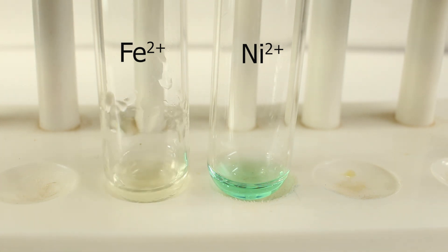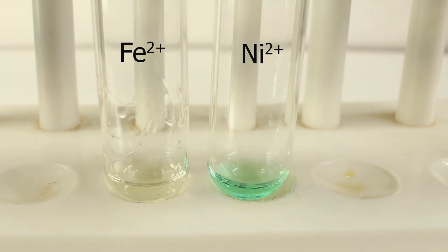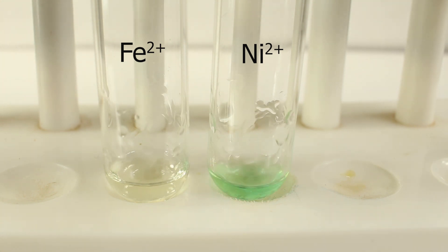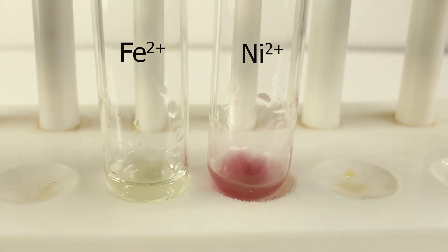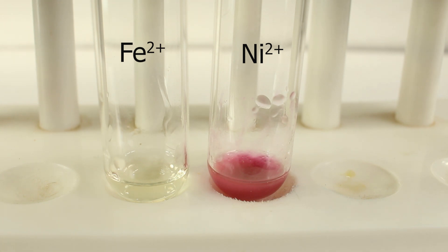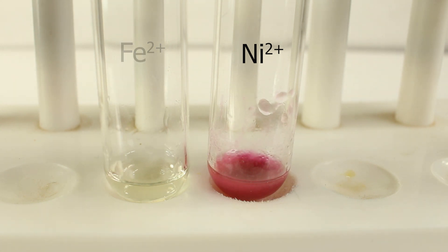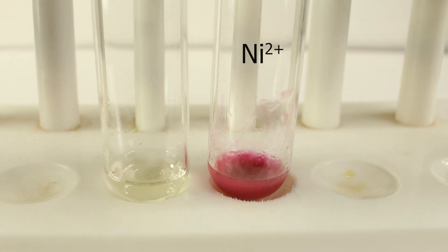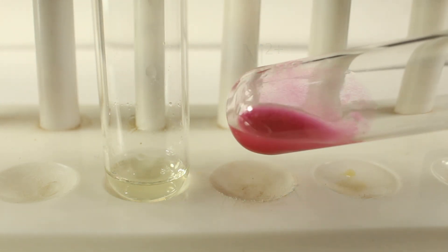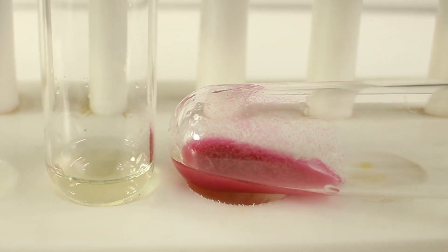No visible change in the case of iron-2. What about nickel? The nickel-2 solution changes from a green solution into a raspberry red or bright red precipitate.